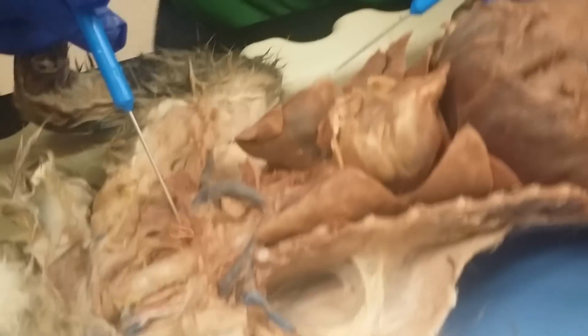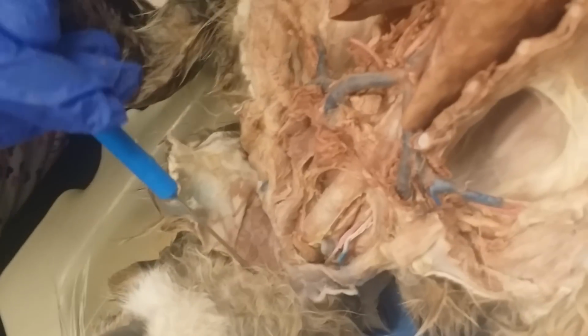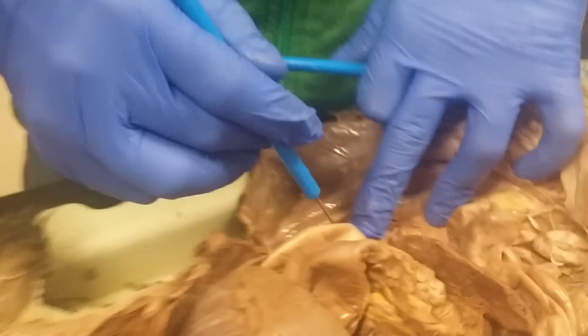And then other than that, it's not too bad. You got like the trachea. This one doesn't really have the larynx. The larynx should be further up in there. Just look on the internet for like the digastric muscles, which should be right here. And then the sternothyroid, which would be right in there, but you can't see it. And then the omohyoid, which is going to be right up in here. But look those up on the internet. You got some foam right here. That's pretty much it. I mean, you might have like some like renal vein and renal artery.